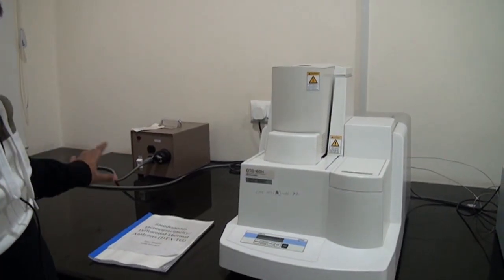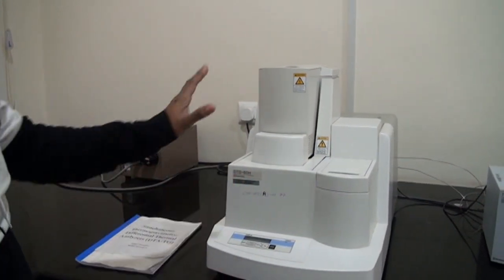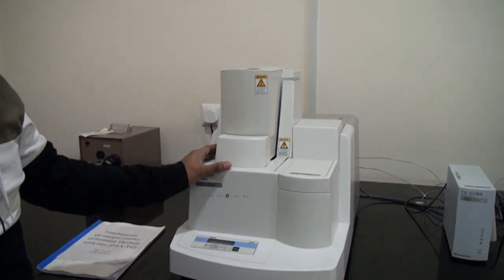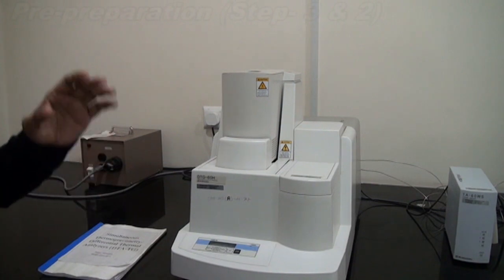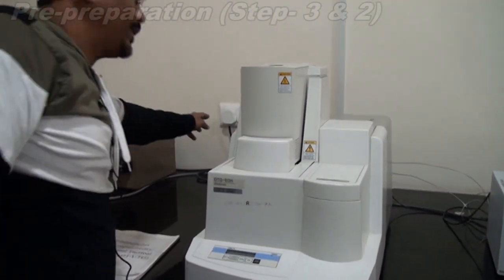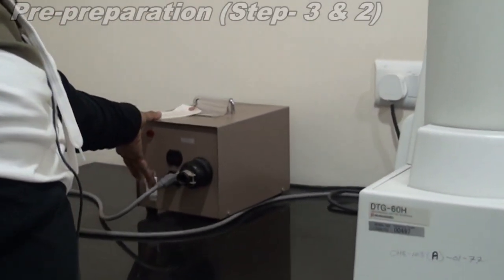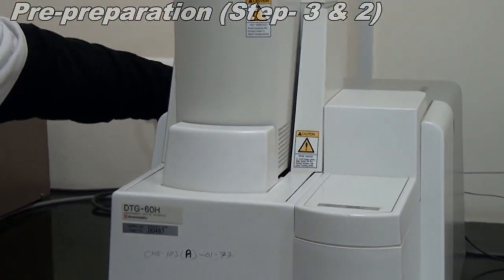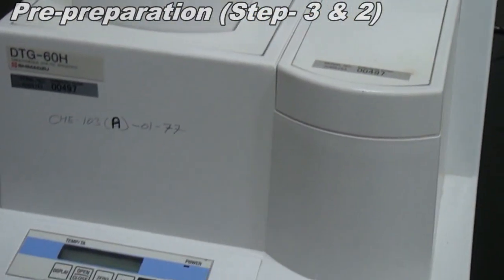So here is the DTA-TGA experiment. You will have the electrical furnace of the DTA-TGA, which is mainly the instrument. Before starting the experiment we need to switch on all the equipment. First we connect the power switch, and there is a stabilizer to control the power. This is the DTA-TGA electric furnace, where you keep the sample and do the thermogravimetric analysis.